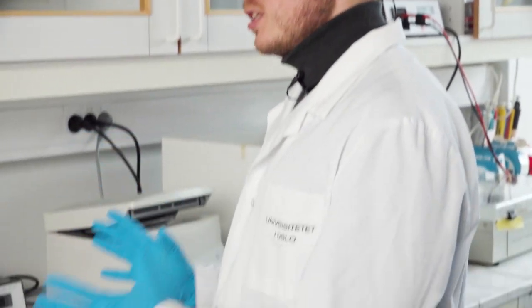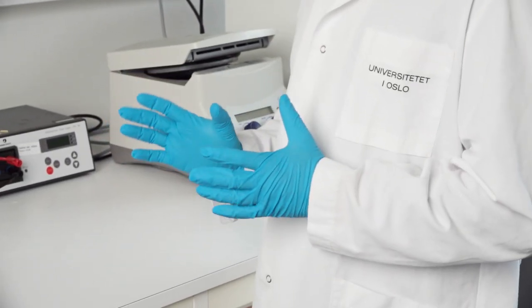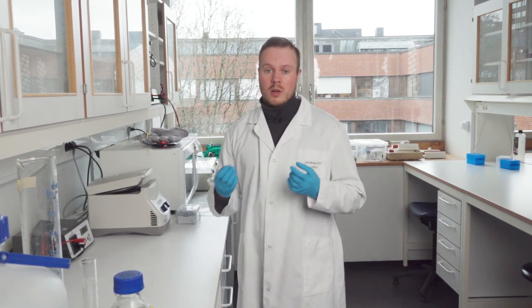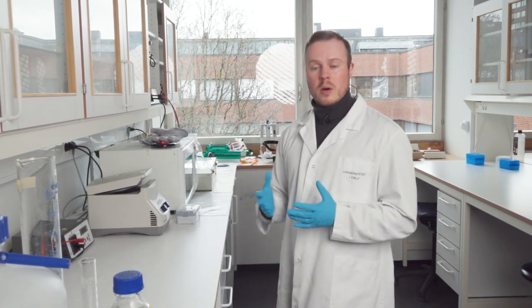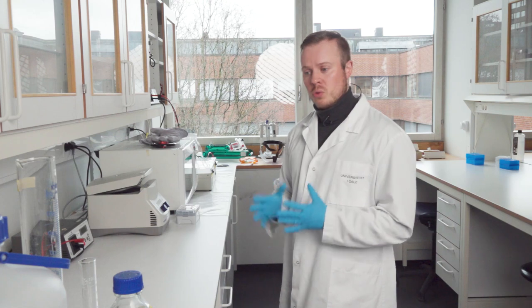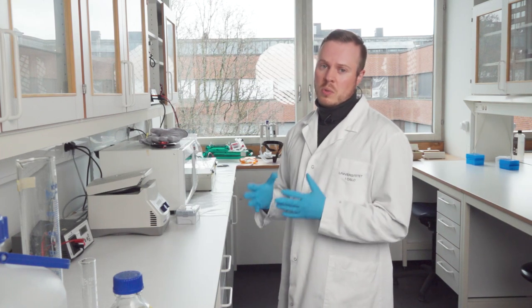The gel is a very important checking point after both the first and second PCR steps. Now I will show you the reagents and tools we need to make a proper gel.